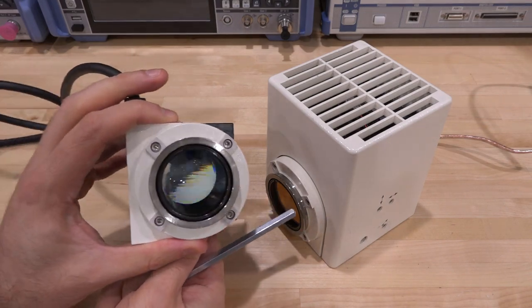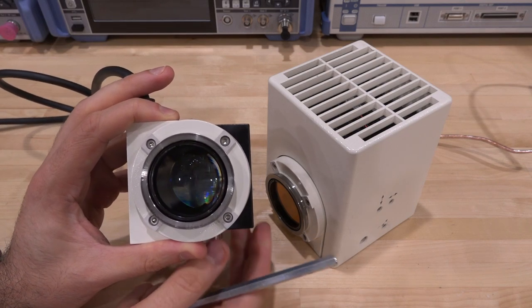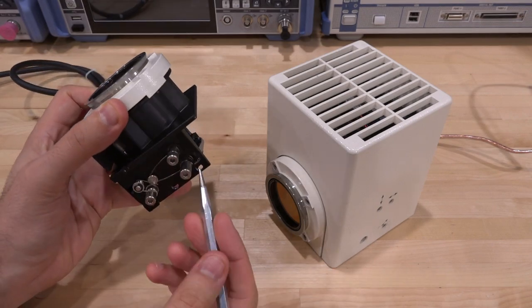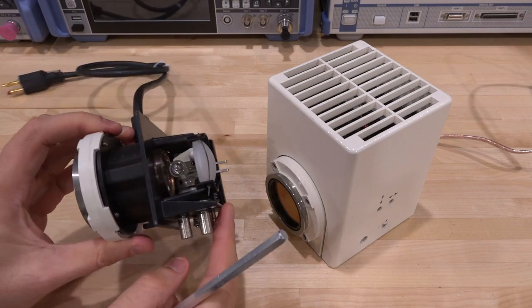And if you look through the lens, you can actually kind of see the filaments in focus. And that's what you want. In order to get the Köhler illumination from the light source, you want the filaments to be in focus. And there are adjustments here to do that, to move it in different directions, to really put it in focus, which is already done for this light.